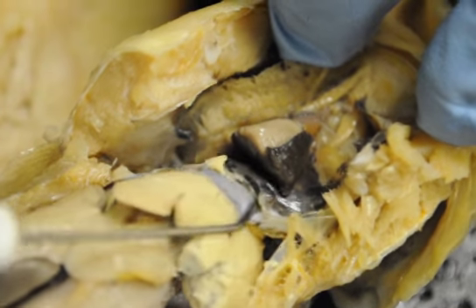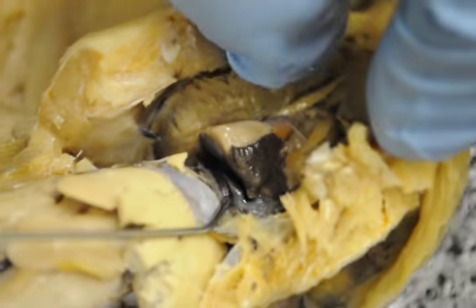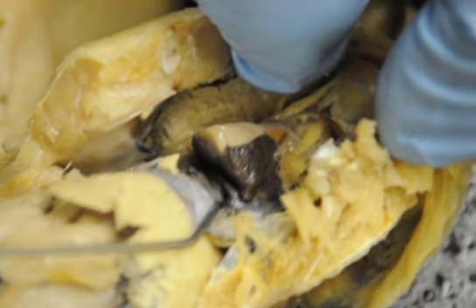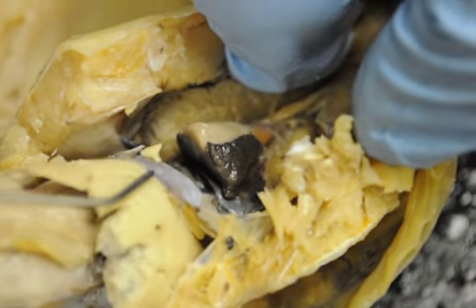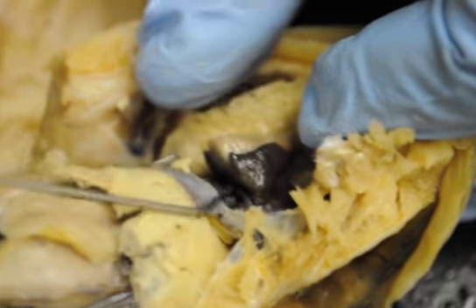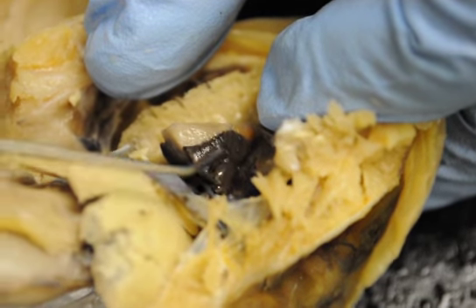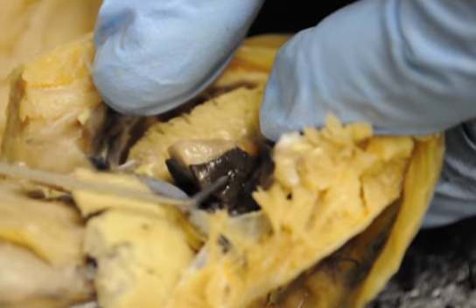Now back here, this sac, back here in the back, is the sinus venosus. This is returning blood from the two cardinal veins, anterior and posterior cardinal veins, into the heart, and from the hepatic vein coming back from the liver. It empties into the sinus venosus. That will empty into this dark gray or dark brown structure up here, which is kind of soft. This will be the atrium.